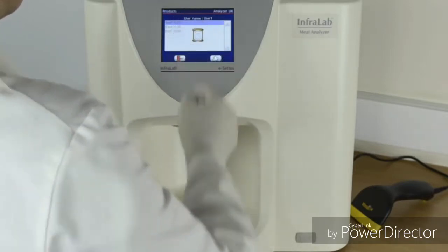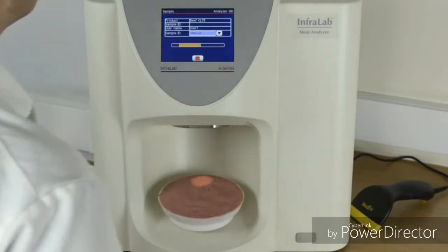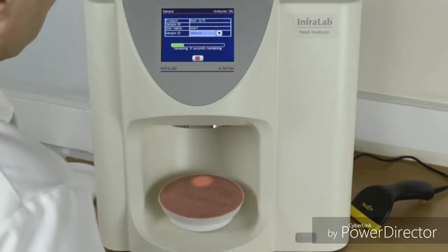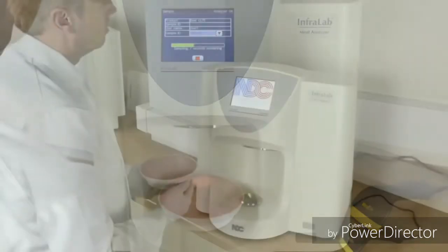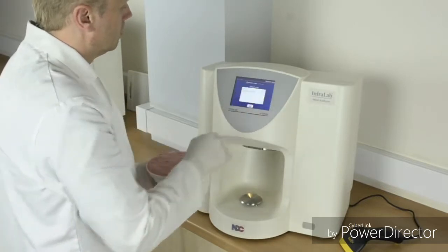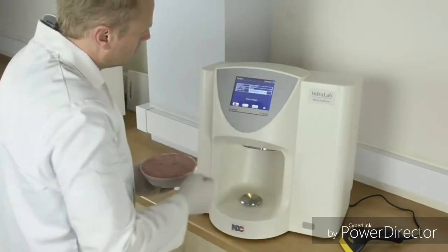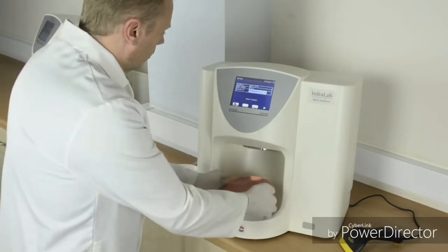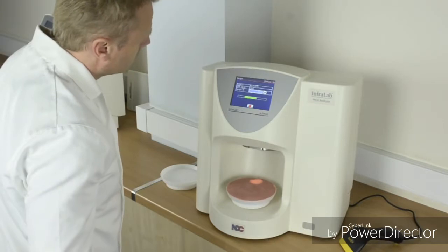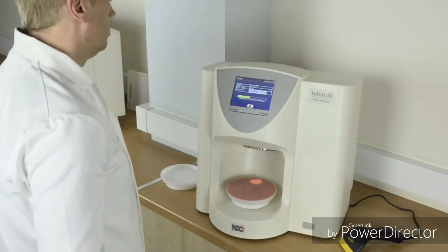Infralab is secure. Each user accesses the Infralab via a unique passcode, while the manager has full control over the functions each user can access. Each time the Infralab is used, the date, time, user name, and results are stored in a unique measurement file. Infralab can store up to 10,000 measurement files and has capacity to store measurement parameters for up to 200 different products.